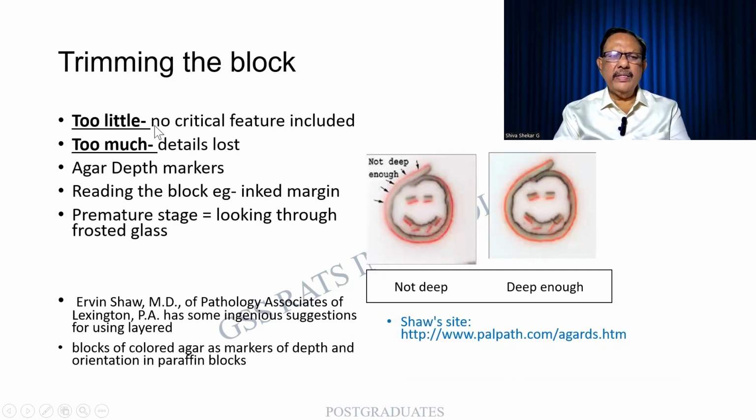Trimming the block. As I said, if you trim too little, there will be no critical feature. And if too much is trimmed, all the details can be lost. So there has to be a margin. Look, in this case, both of them look almost similar, but the margin is quite deep within the eyes, whereas here it is well brought out. So it is ideal. These are the references. I would like you to kindly go through them.